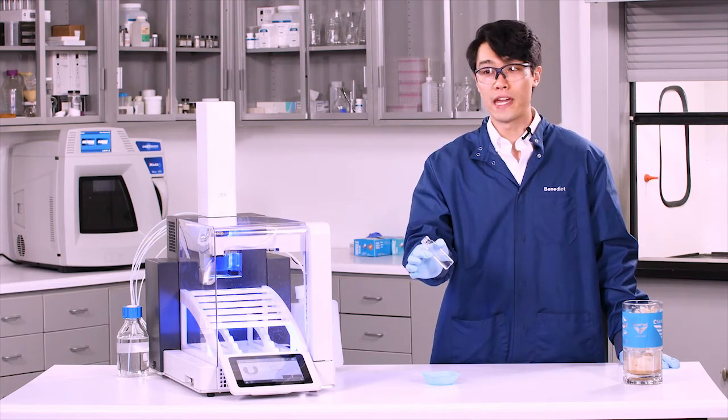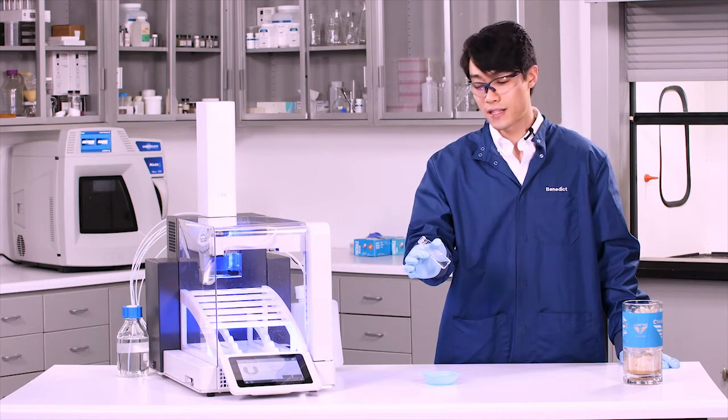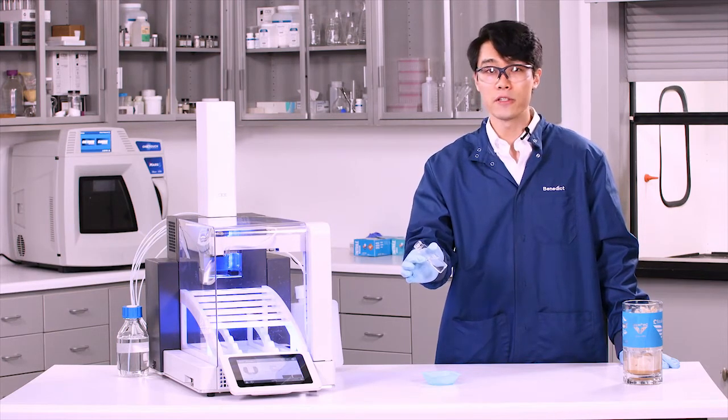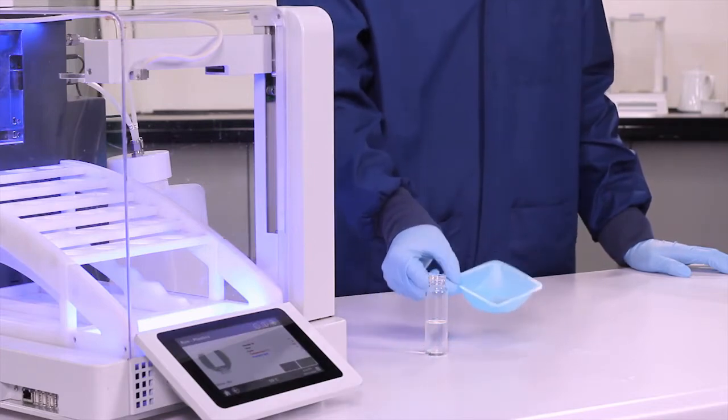Common analysis that we might be looking for in a plastic extract include things such as UV stabilizers, antioxidants, slip additives, or phthalates. And here we have our extracted plastic sample.